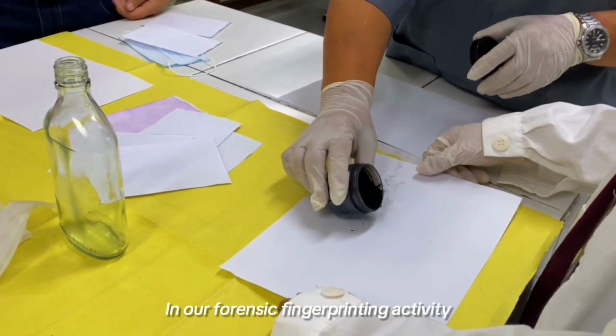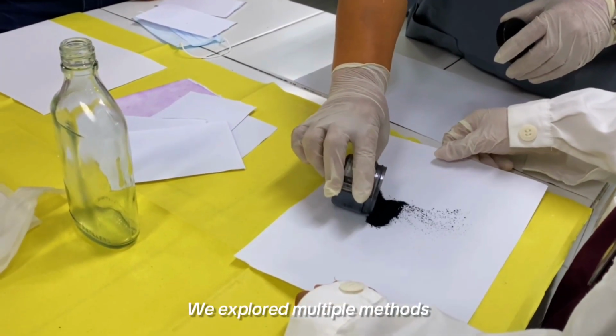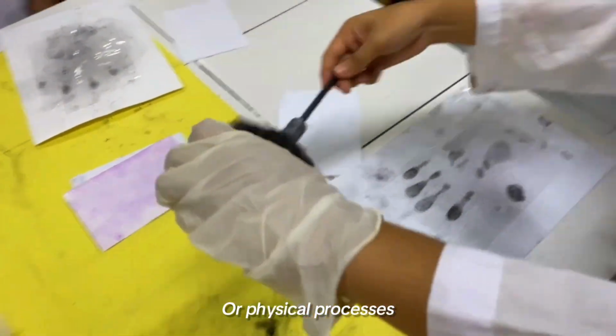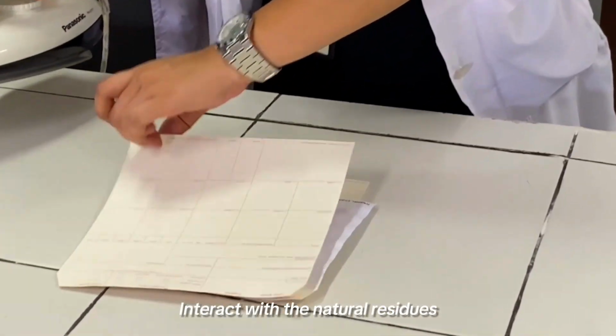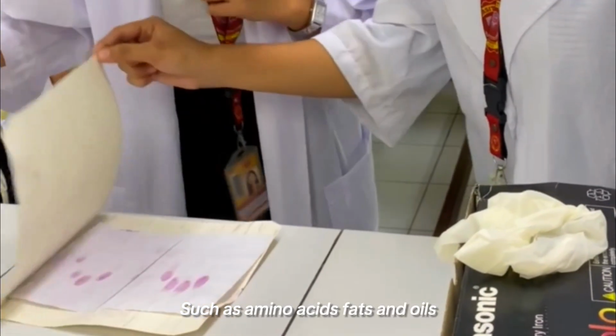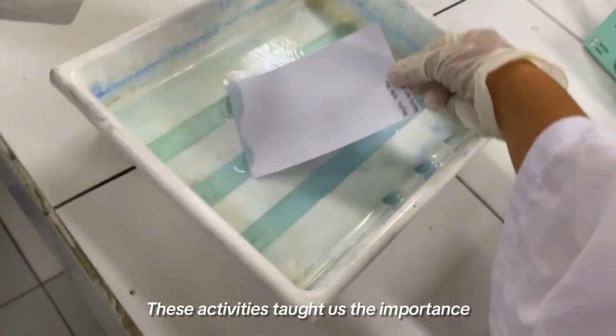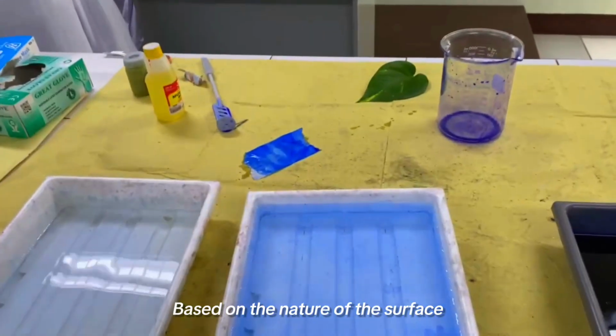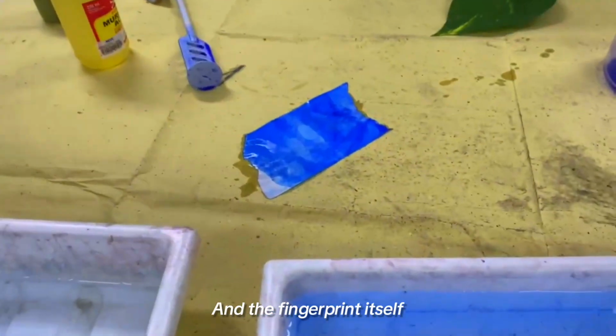In our forensic fingerprinting activity, we explored multiple methods to make latent fingerprints visible on various types of surfaces. Each method demonstrated how different chemical or physical processes interact with the natural residues left behind in a fingerprint, such as amino acids, fats, and oils. These activities taught us the importance of choosing the appropriate technique based on the nature of the surface and the fingerprint itself.